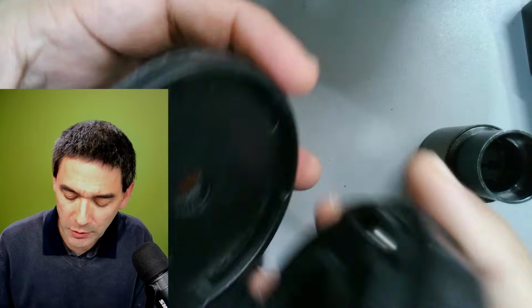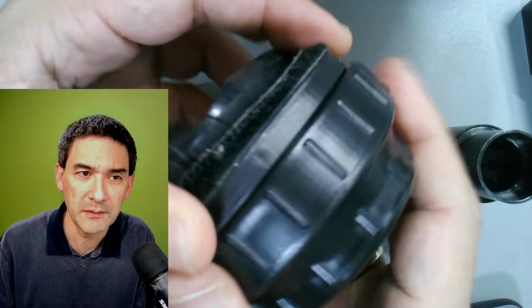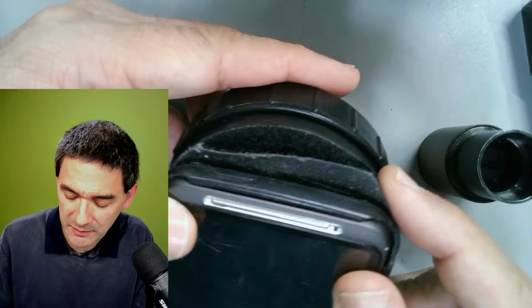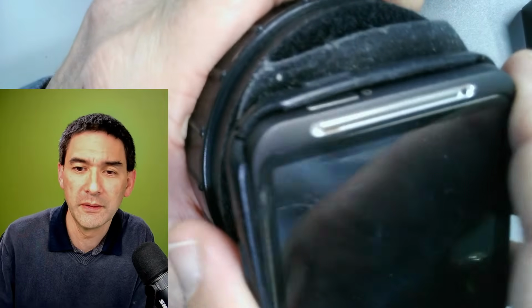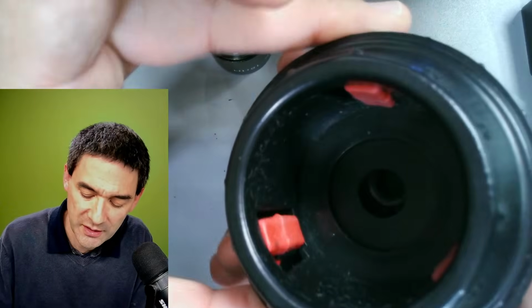I've been using it a little bit with my old mobile phone, but, interesting concept in any case, but not, I would say, the most stable configuration, because the whole system, not only here with the eyepiece, but also up here, is a little bit wobbly. So that's the thing. But I just want to show them to you as an interesting concept.